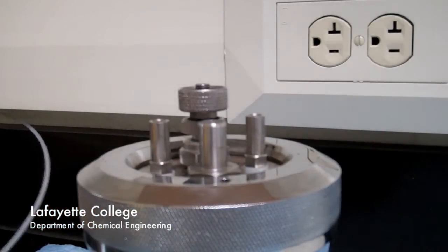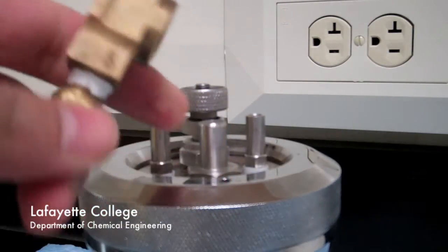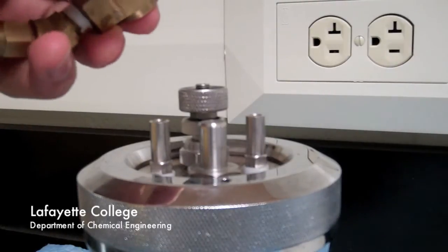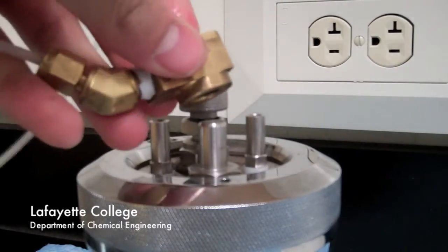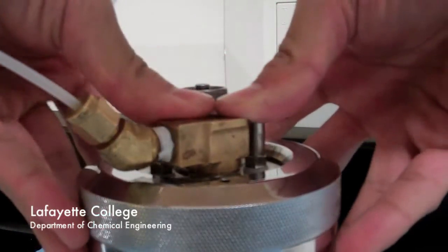Take the oxygen hose and wet the O-ring at the end with DI water to again make it easier to attach and remove. Slide the connector onto the oxygen inlet valve of the bomb and turn on the oxygen using the black knob of the pressurized tank. Monitor the pressure of the bomb with the gauge on the oxygen tank. The bomb should be pressurized to about 30 atm.